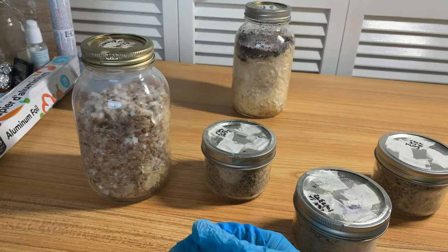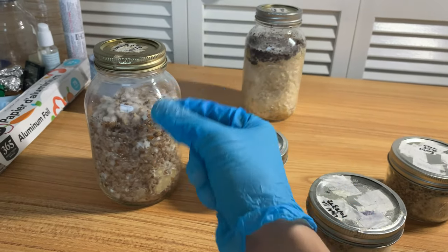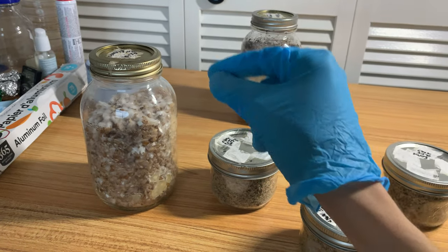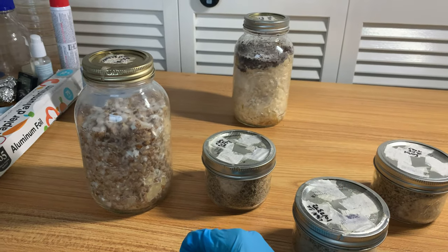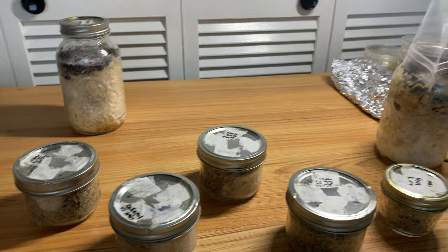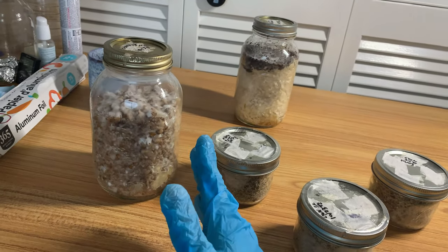I had high hopes for it because even though there's the agar wedge, it's not just on the top layer that the mycelium is on - there are actually little filaments going down all throughout the wedge inside. So even though there weren't any big bits that the syringe could suck up, I knew that there had to be some mycelium in there.